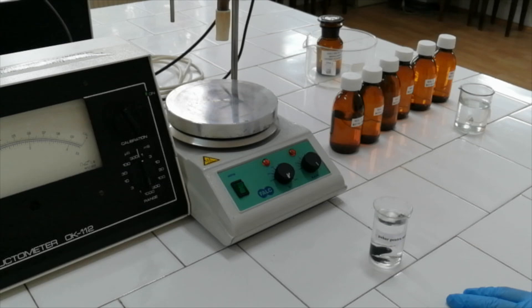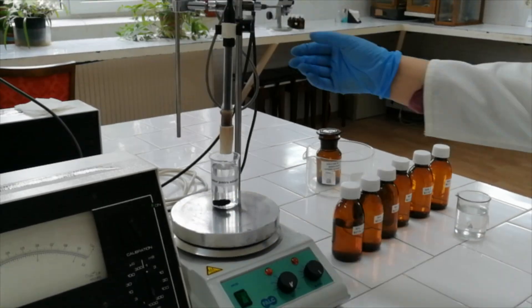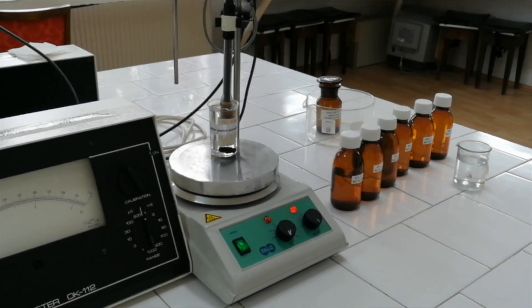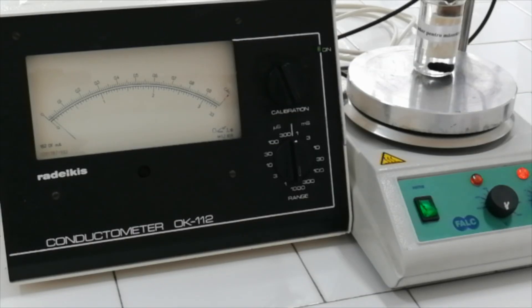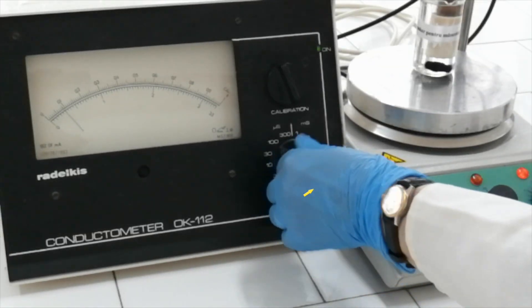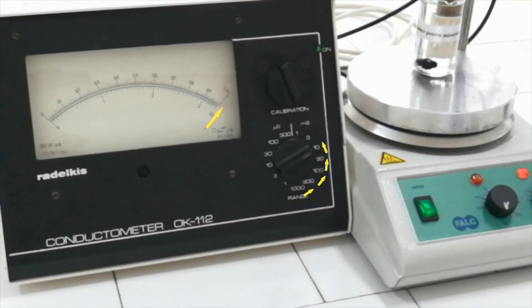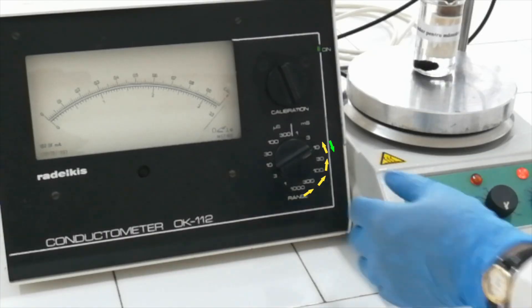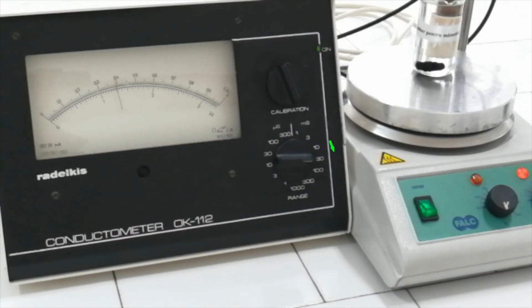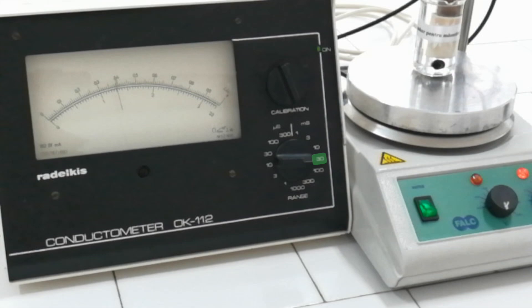First, measure the electrical conductance of distilled water. Dip the electrode in the study solution. Use the following procedure to read the conductance value. Find the appropriate measuring domain by rotating the range button counterclockwise. Continue rotating until the indicator exceeds the maximum value of the scale shown on display. Then turn the range button back one position. In this way, you find the range domain to read the conductance value of the solution with maximum precision.